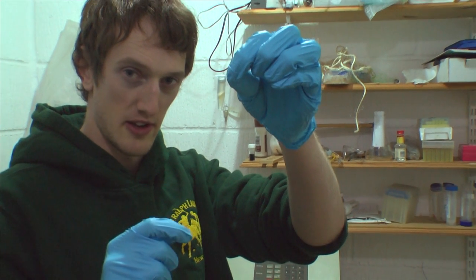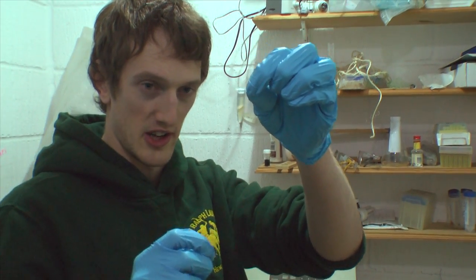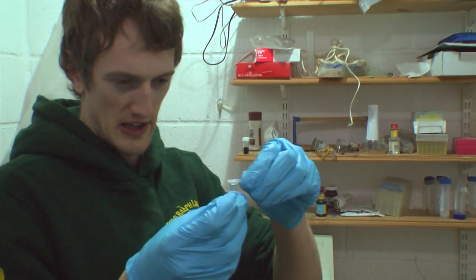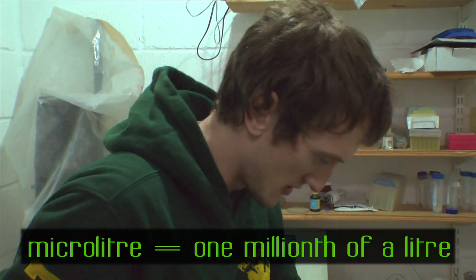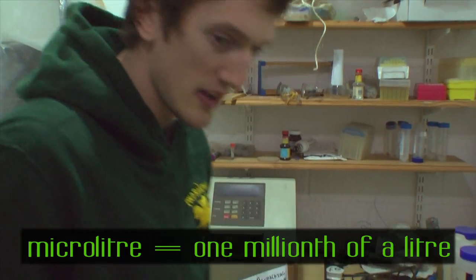The clear bit at the top is, hopefully, water with our DNA dissolved in it. We're now just going to take 200 microliters of that water and keep it, and then throw the rest away.